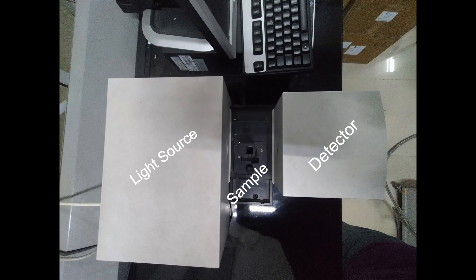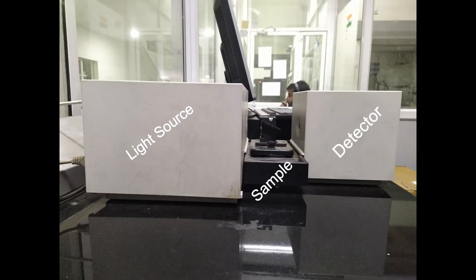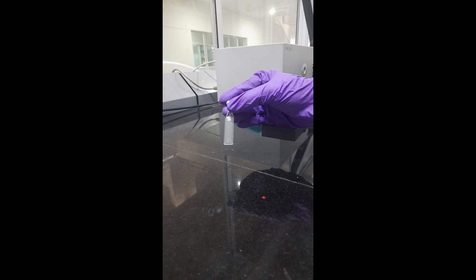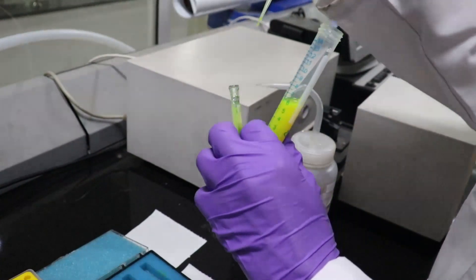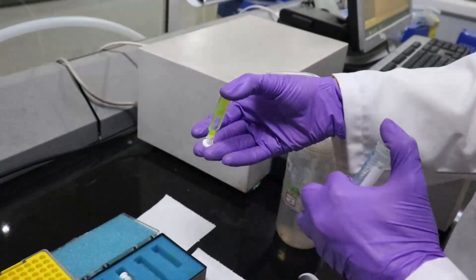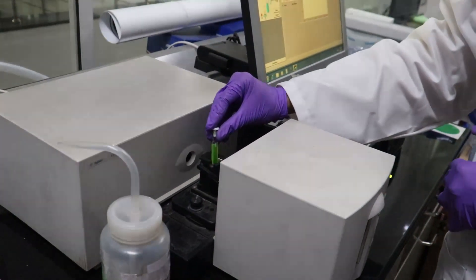We have finished the synthesis of our nanocrystals and we are ready to measure their absorption and emission. This is how a typical steady-state absorption spectrometer looks like. We have a light source on the left, the sample chamber in the middle, and the detector on the right side. Light falls from the light source onto the sample, passes to the detector, and the change in absorption is detected. This is a cuvette where the sample is kept for measurement, and the cuvette is filled with the sample and transferred to the sample chamber.